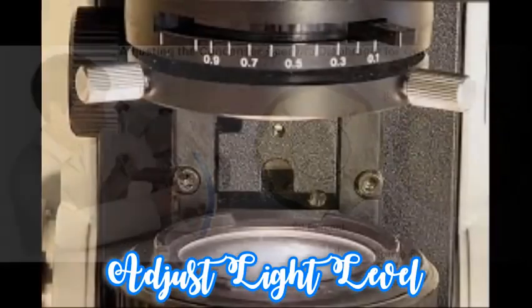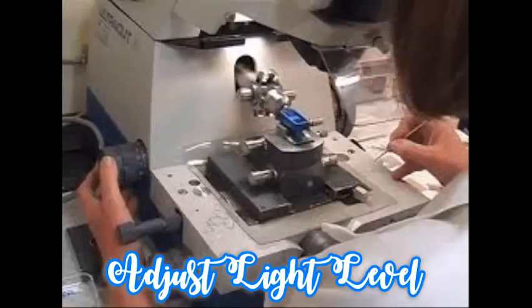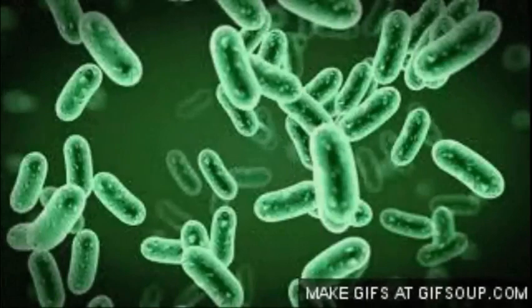There are two places to adjust light level. First is the illuminator. The illuminator is the light source of a microscope, typically located in the base of the microscope. Most light microscopes use low voltage halogen bulbs with continuous variable lighting control located within the base.